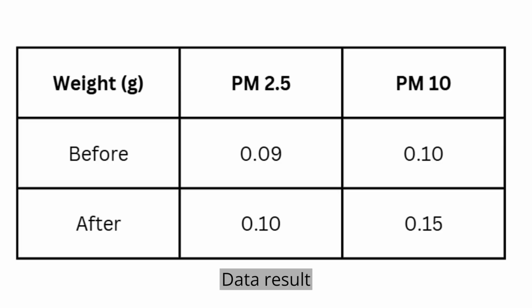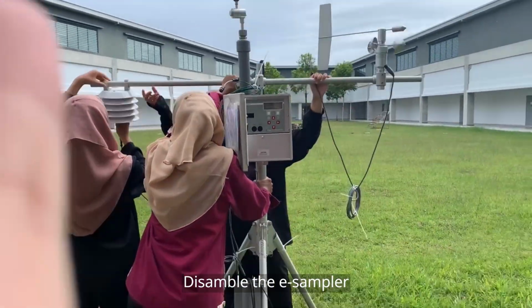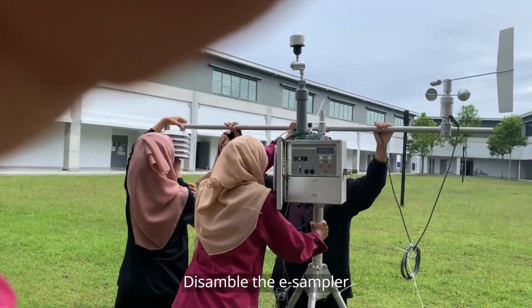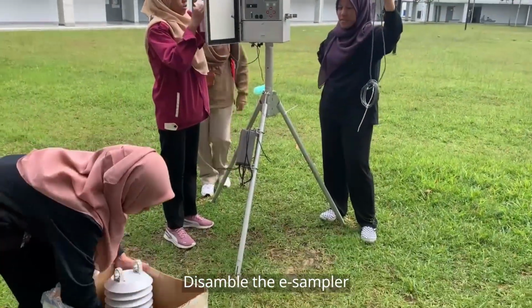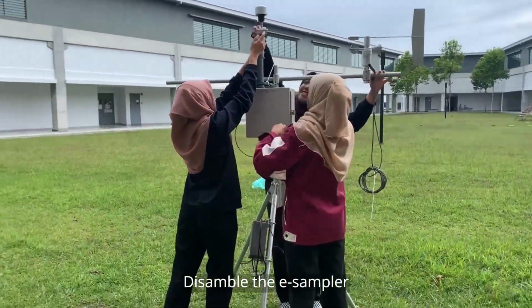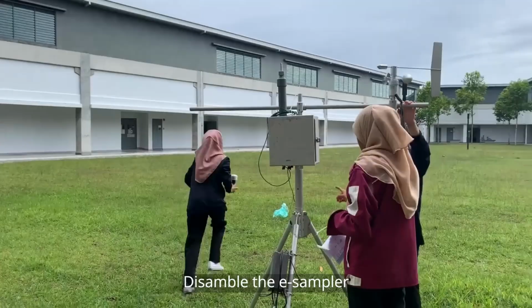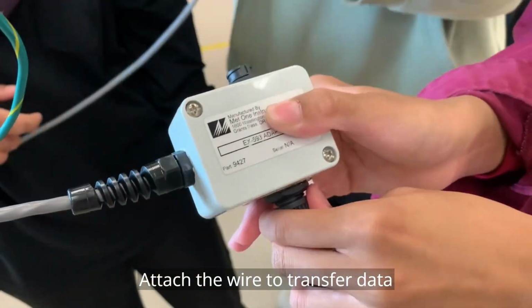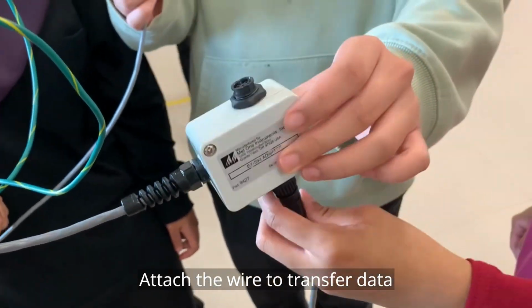This is the recorded data obtained for both PM10 and PM2.5. On the last step, don't forget to disassemble the e-sampler and bring it back to the air pollution laboratory. Extra precaution must be taken in this part. Then connect the wire from the control device of the e-sampler to the computer.